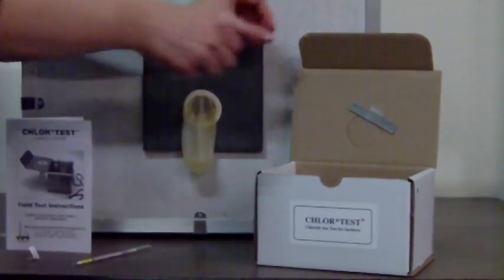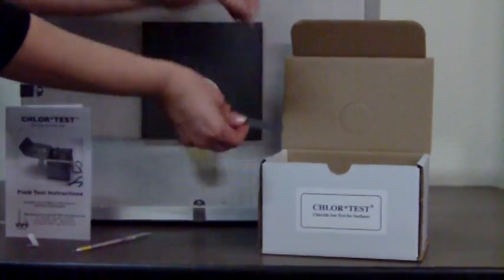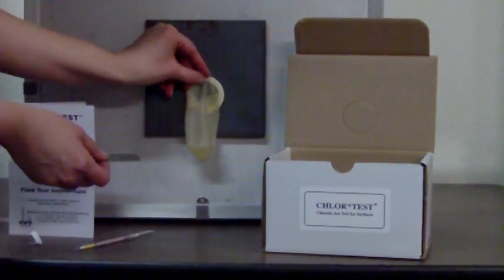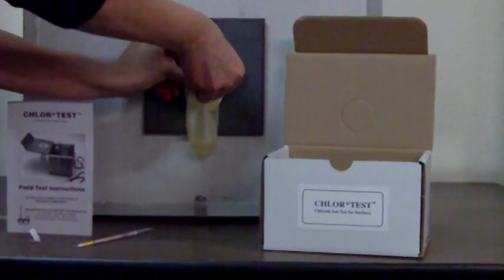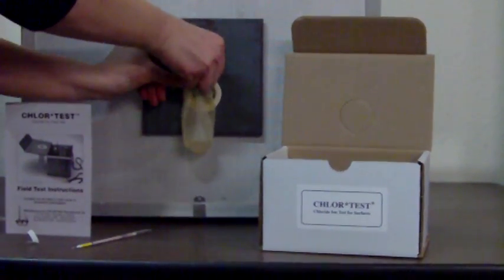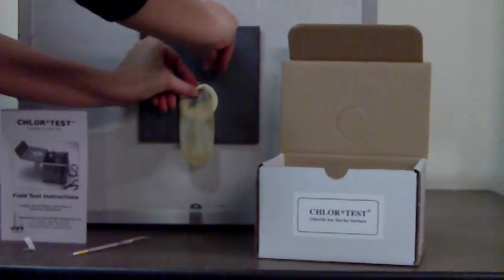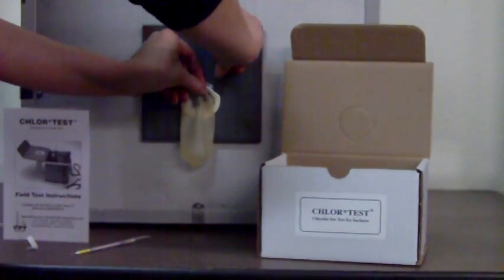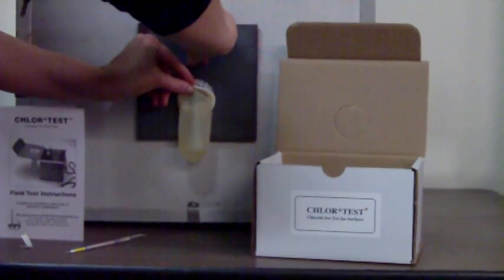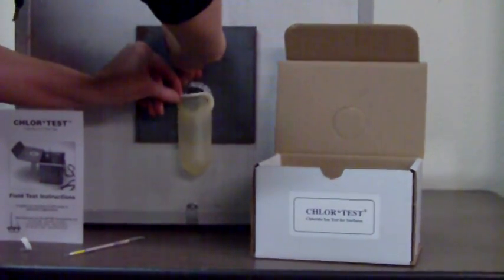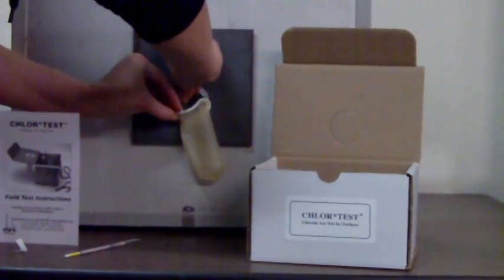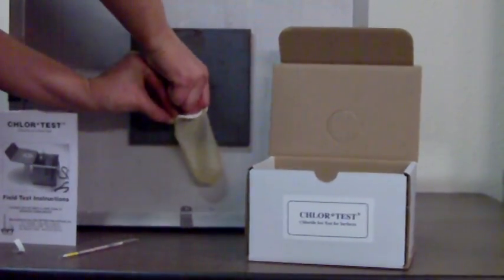In the lid of the kit is a snapper. It's provided to be used to snap the ends off of the glass tube, but it makes a great little device to help peel that sleeve off of there. Use it kind of like a scraper. The adhesive does stick very, very well. Oftentimes people are on older rusted pitted surfaces that require a real high quality adhesive. So we provide adhesive good enough to seal to even the worst type of surfaces.